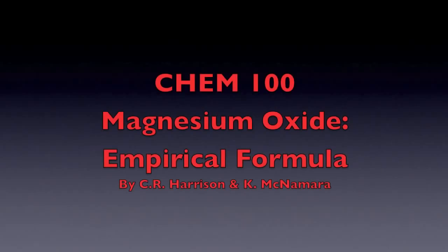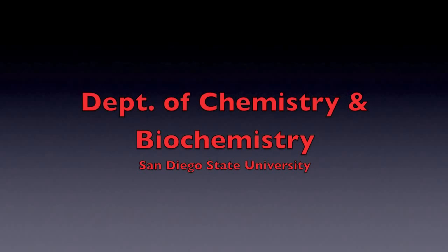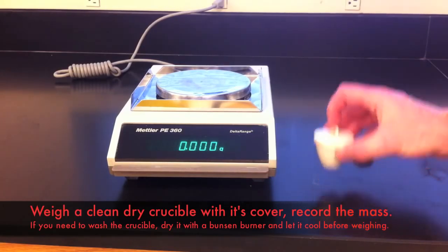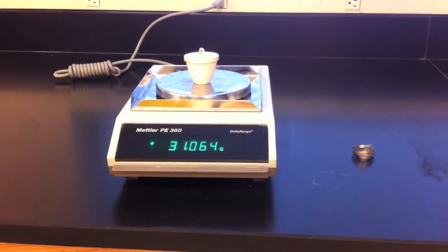In this lab, you will experimentally determine the empirical formula for magnesium oxide. You will do this by combusting magnesium in an oxygen-rich environment. To begin, you will need to determine the mass of a crucible and its lid. Make sure they are both clean and dry before you weigh them.